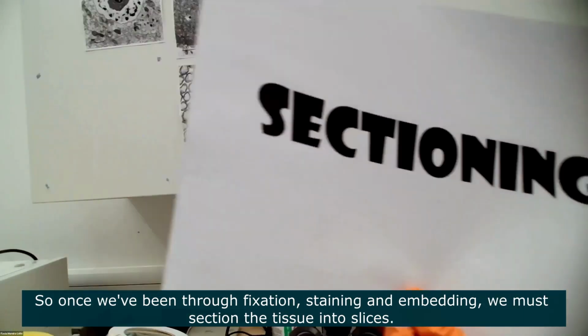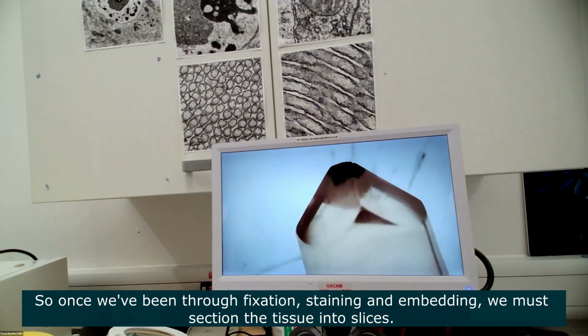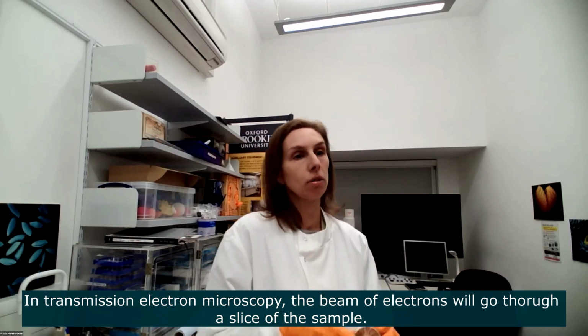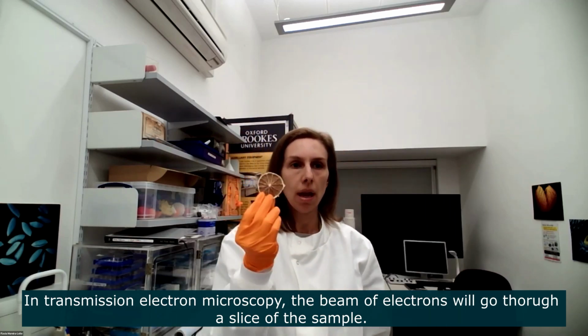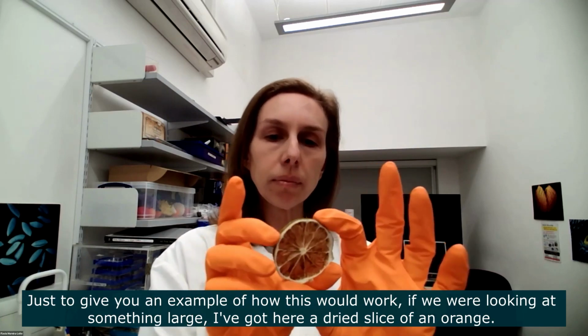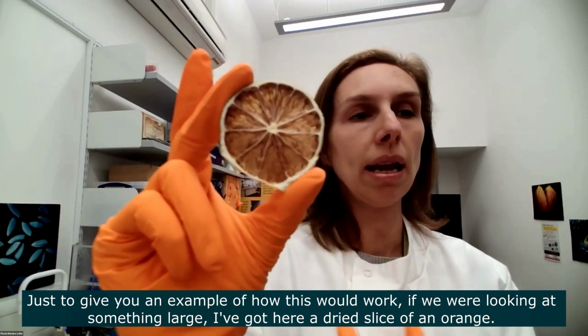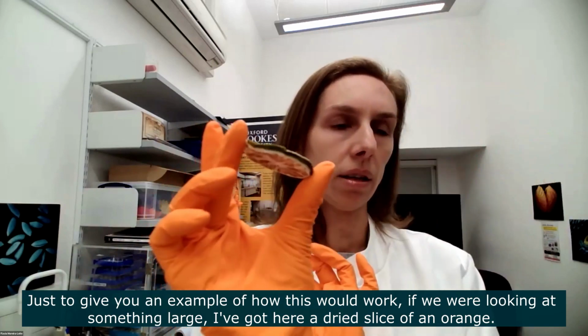So once we've been through all these steps of fixing, staining, embedding, we then have to section the tissue into slices. So what happens in transmission electron microscopy? In transmission electron microscopy, the beam of electrons will go through a slice of the sample. And just to give you an example of how this microscopy would work, if it was something to the naked eye, I've got here a slice of an orange. Yeah, so this is a slice of an orange.